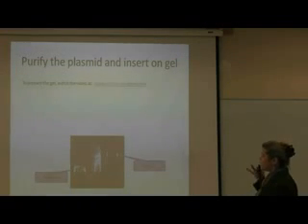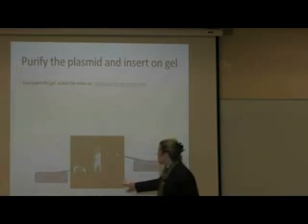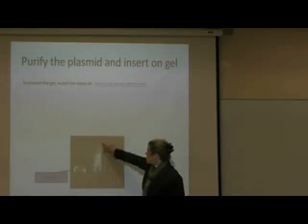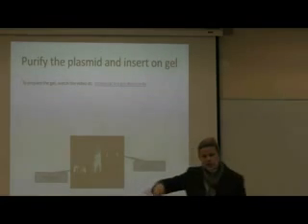Gel. Or you're going to make the gel, you're going to run it on the gel. Okay, so this down here is the original wells, and this is the DNA ladder. It kind of got a little bit washed. This gel was probably not mixed thoroughly.